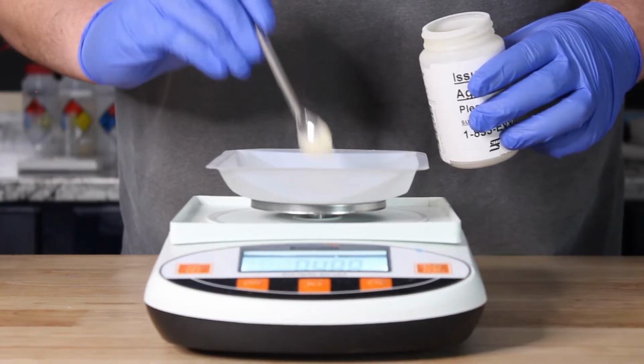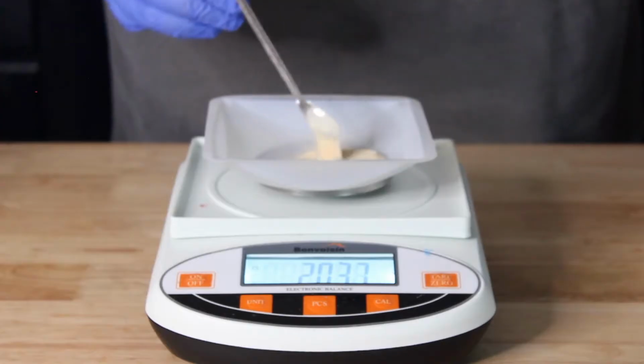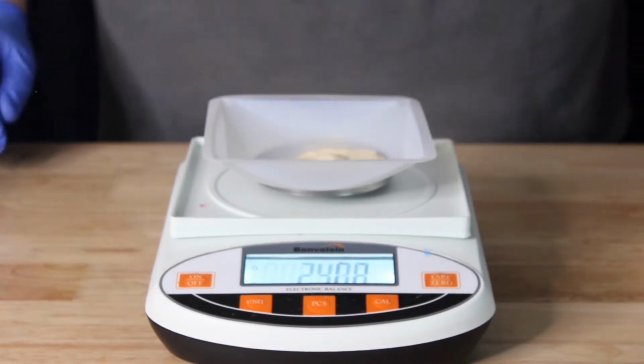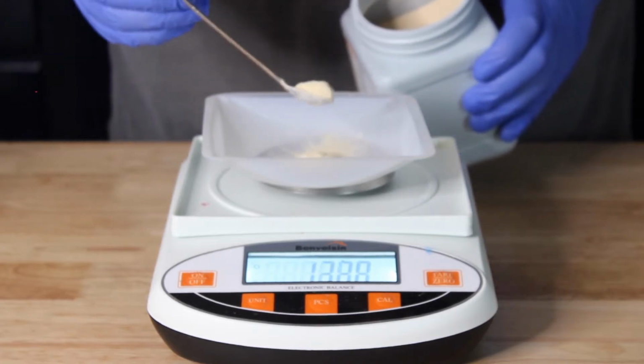We will first measure out the correct amount of powder in grams for each growth media for 100 milliliters of water. 100 milliliters of added water will create enough growth media for about 3 petri dishes of selective media or differential media.